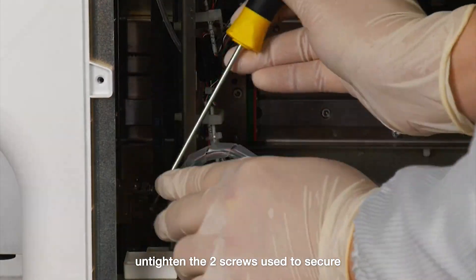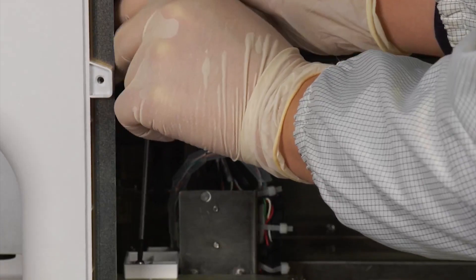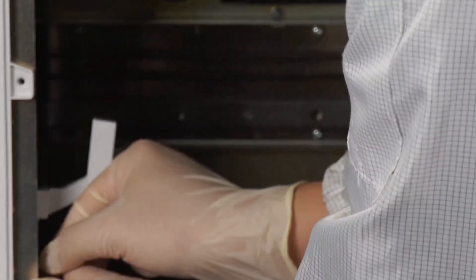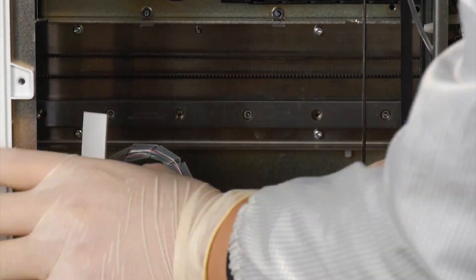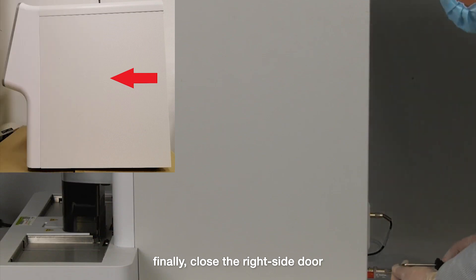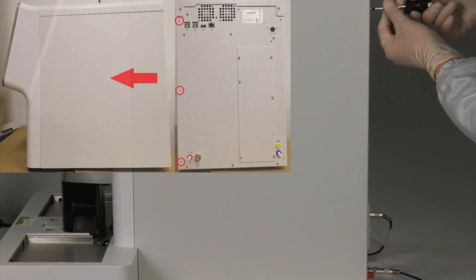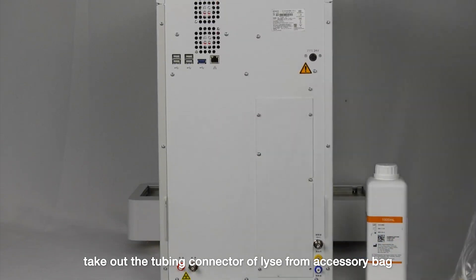Untighten the two screws used to secure the fixed block of the shaking structure and take out the white fixed block. Tighten the fixed block onto the shaking structure and remove the dust patch. Finally, close the right side door and secure it with the three screws as figures show.